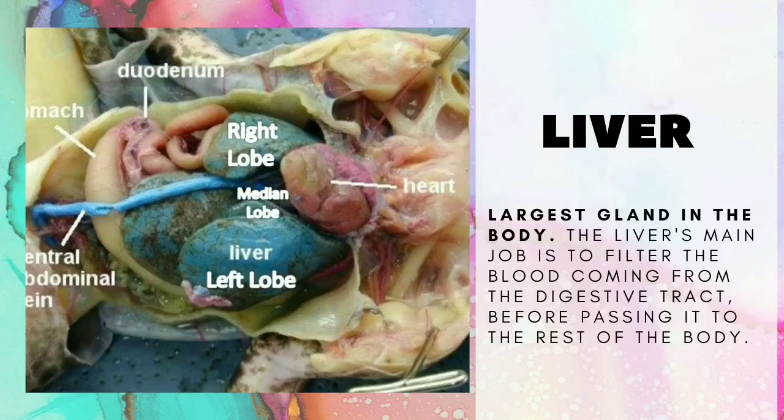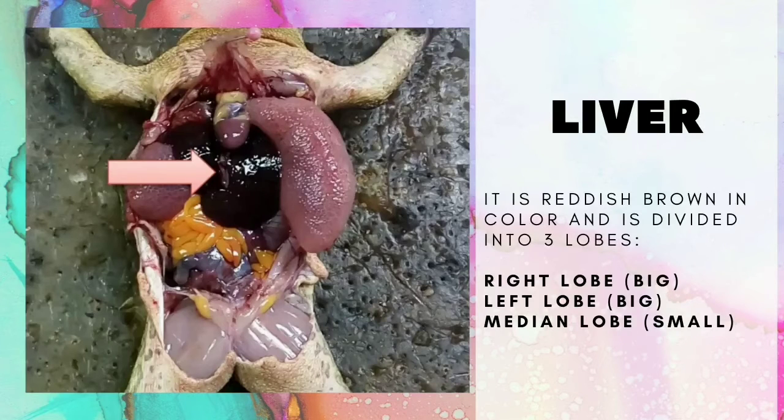The liver is the largest gland in the body. The liver's main job is to filter the blood coming from the digestive tract before passing it to the rest of the body. It is brown in color and is divided into three lobes: the right lobe, left lobe, and the median lobe.